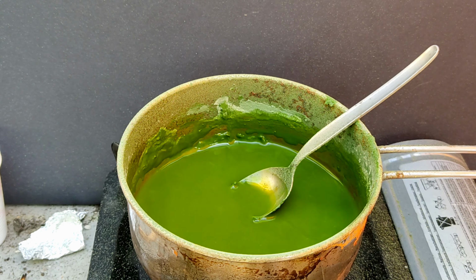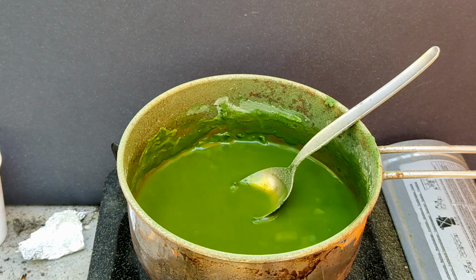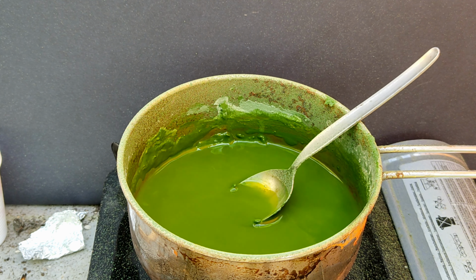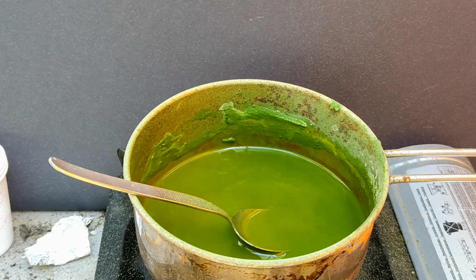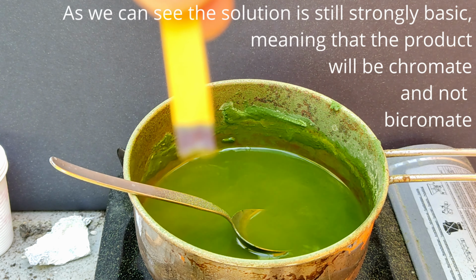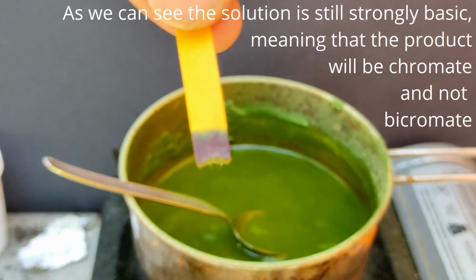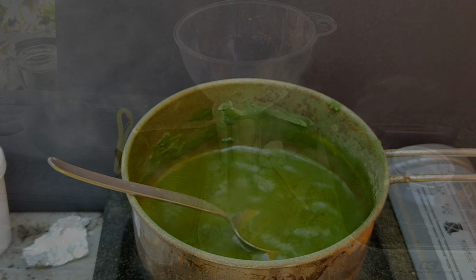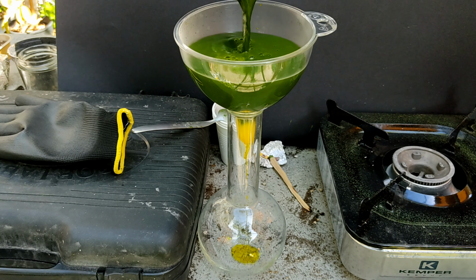When the solids are near room temperature, we can start adding water to dissolve the product, along with the impurities, which will mainly be potassium hydroxide, nitrate, and nitrite. We can thus start heating up the mass to dissolve everything. When everything has dissolved, we can begin filtration.